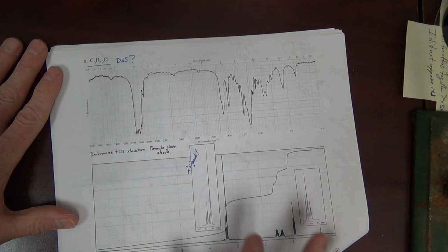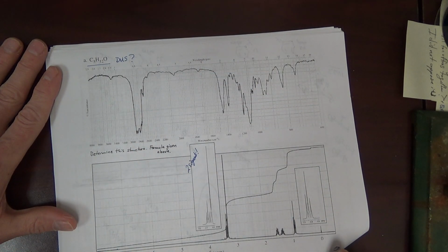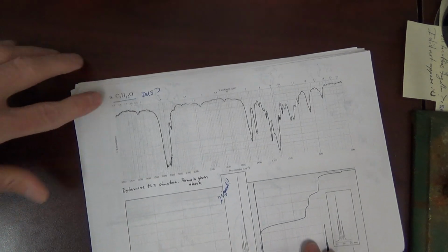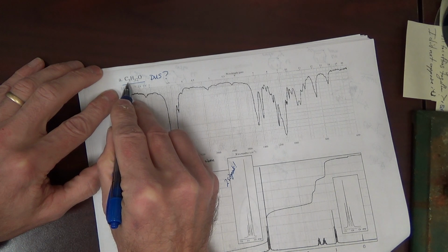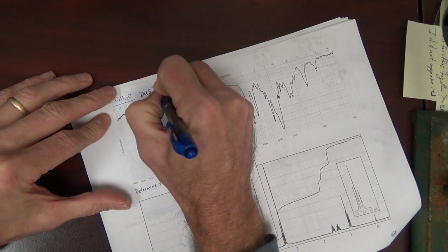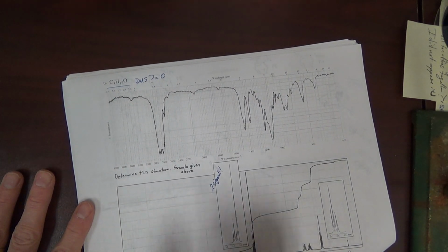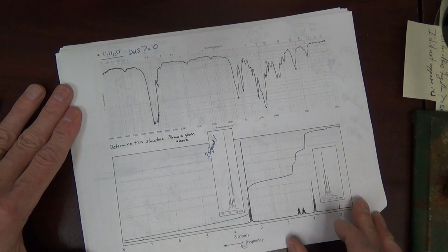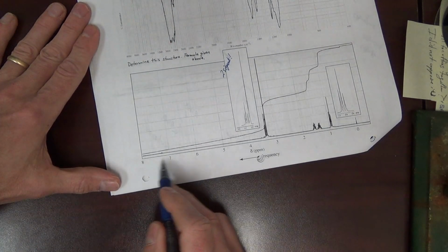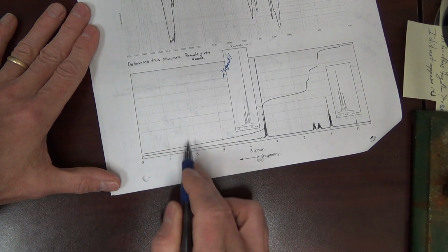It's not entirely comprehensive. It only includes Proton NMR and IR. It does not include carbon NMR or mass spec. Formula is given. Degrees of unsaturation, C5H12, 2N plus 2, 12, is 0. 0 degrees of unsaturation. That's very powerful information. This compound has no pi bonds and no rings. Since there's no pi bonds, there can't be an aromatic ring. And indeed, if you look at the Proton NMR, there are no signals for hydrogens on an aromatic ring.